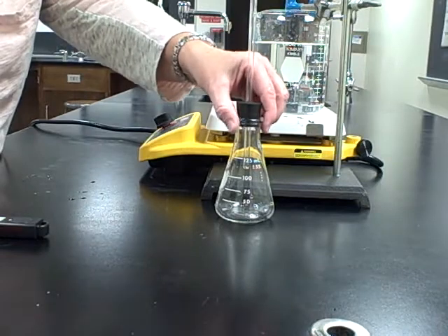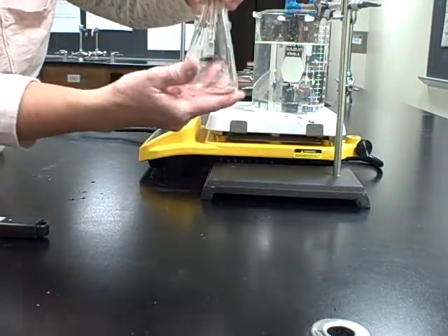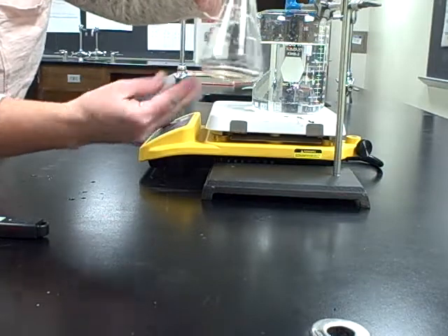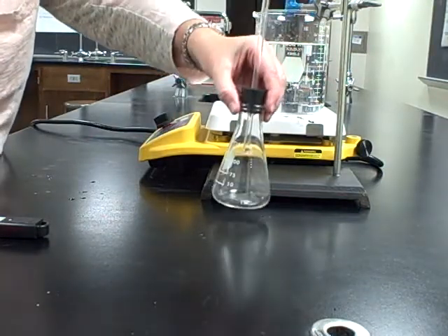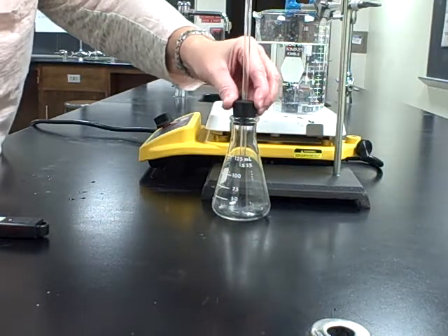Now, if you've just done like I have and had this in the water bath, make sure you wipe this off with a paper towel so those droplets of water aren't included in the mass of your empty flask. Make sure you record that somewhere.